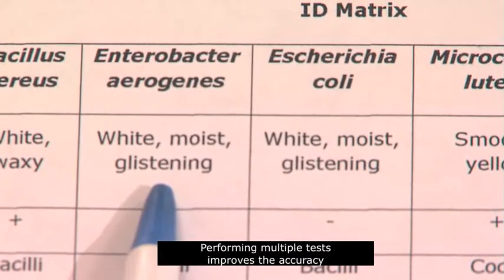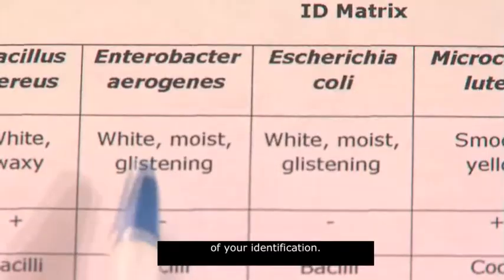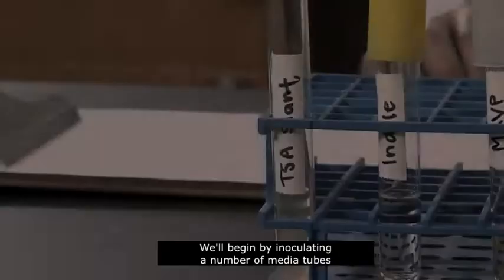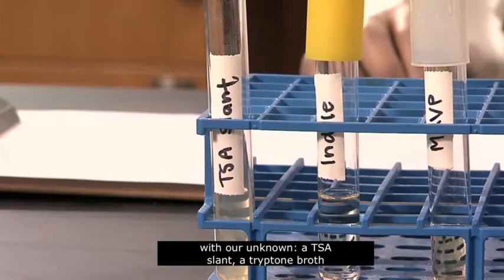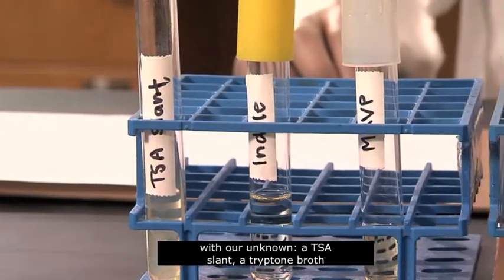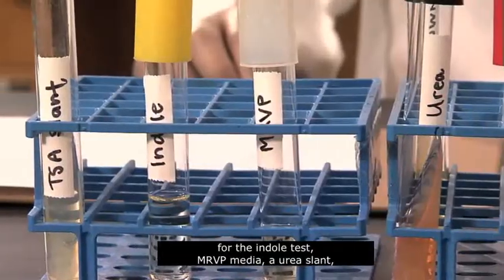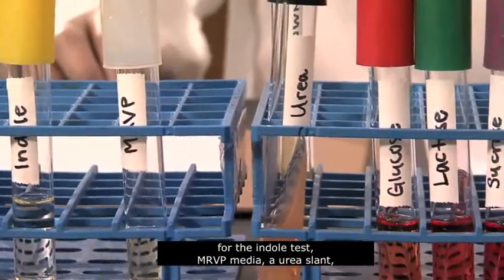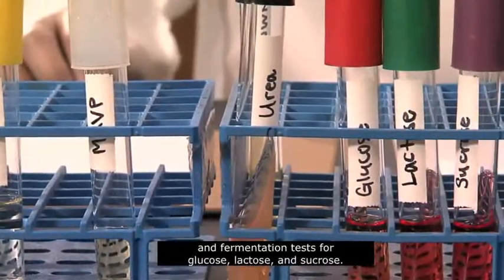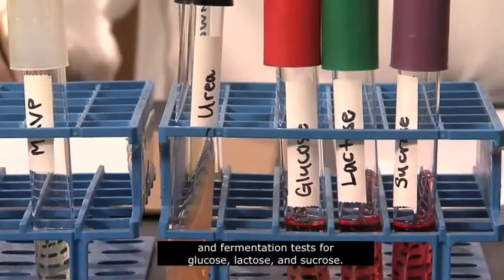Performing multiple tests improves the accuracy of your identification. We'll begin by inoculating a number of media tubes with our unknown: a TSA slant, a tryptone broth for the indole test, MRVP media, a urea slant, and fermentation tests for glucose, lactose, and sucrose.